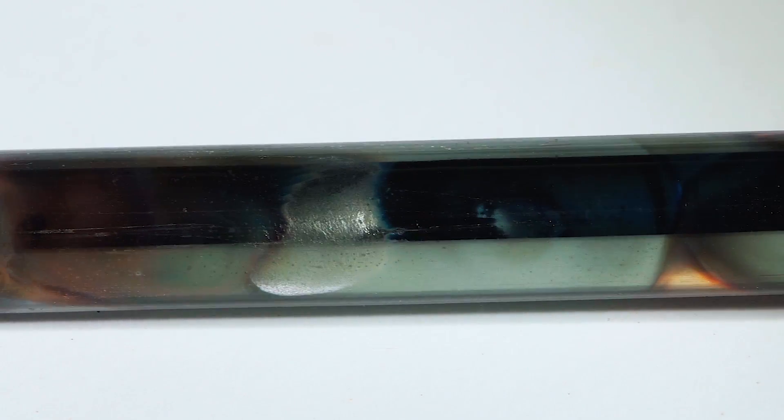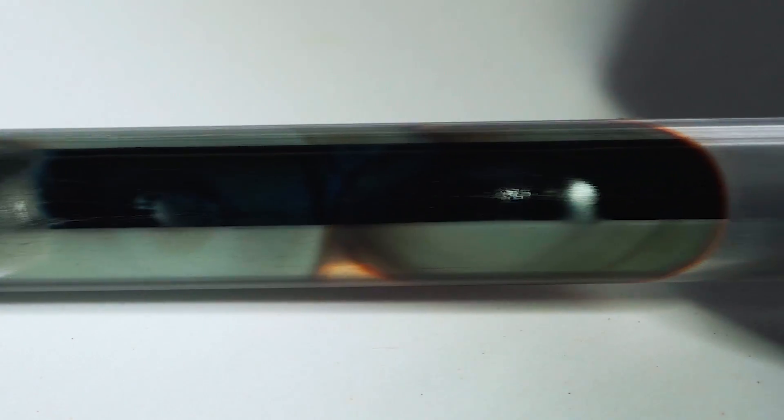And this is how we got a glass tube covered with germanium on the inside. A similar germane decomposition reaction is used in electronics manufacturing to get extra pure germanium.